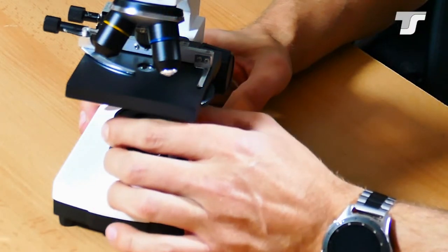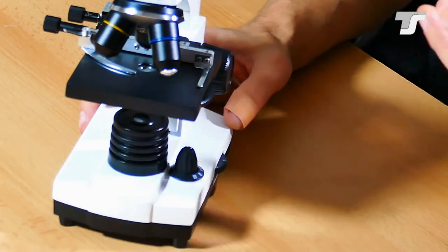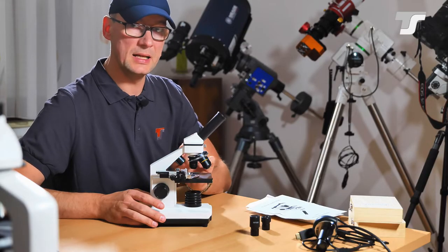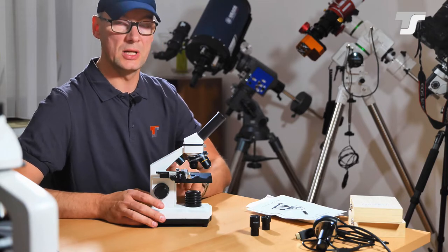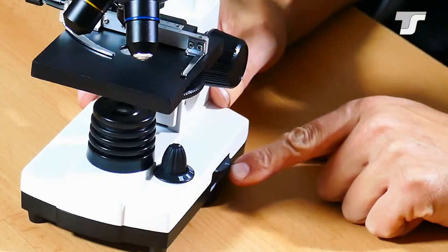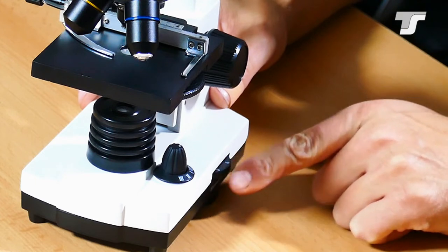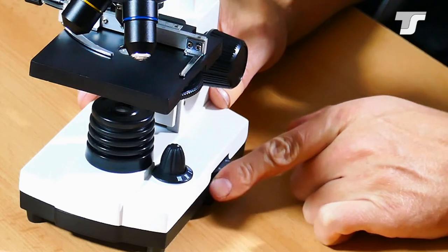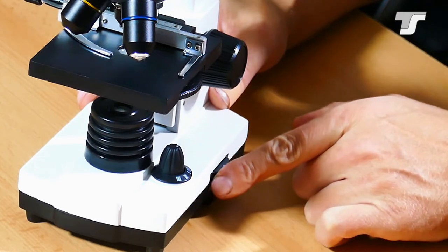And because of the use of the LED, this is not heating your subject, which is really good. And the intensity of the light is adjustable. To adjust the intensity, you use this screw wheel here from basically nothing to brightest light here.